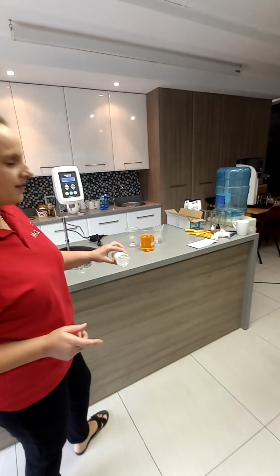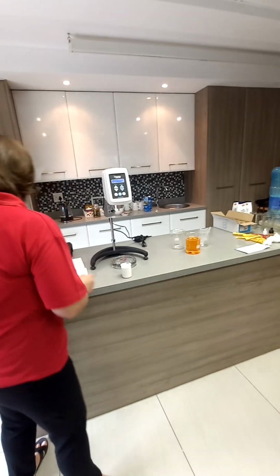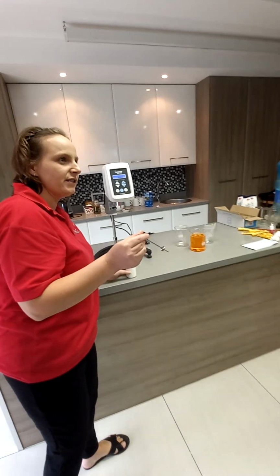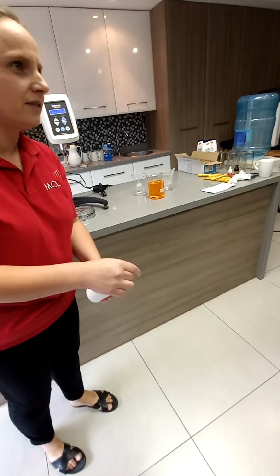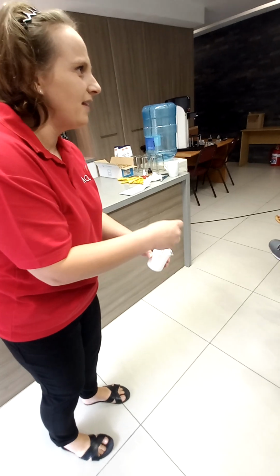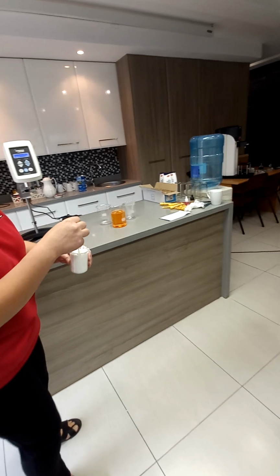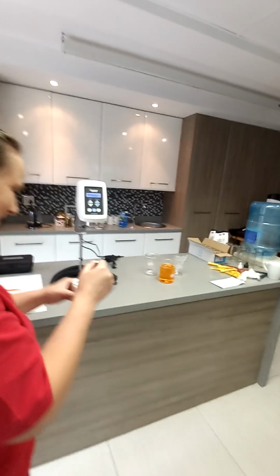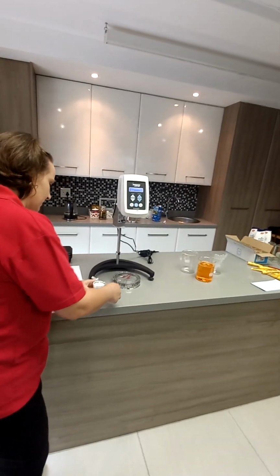What if you have something that doesn't flow? There's a high viscosity, so you're going to use the smallest. If I use this spindle and I stick it in here, what is it doing? It's creating a bend, like a hole. And then if you turn the spindle, there's not going to be any resistance. But you're still going to create a hole as soon as you start moving the spindle. There is a solution. What sample is that?